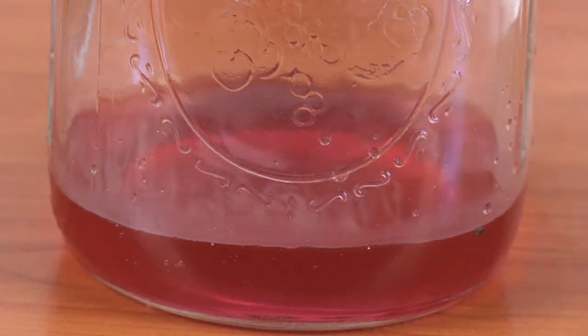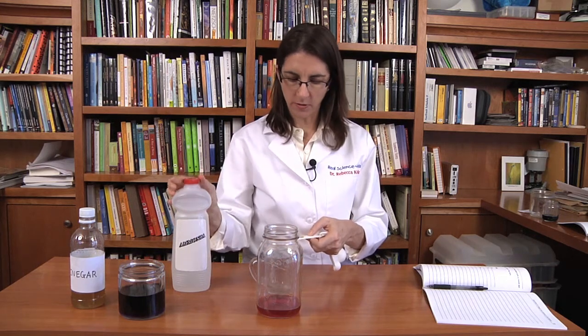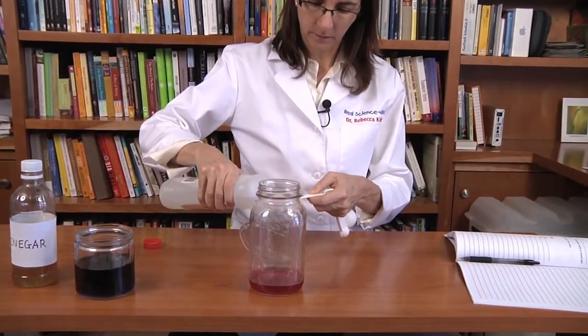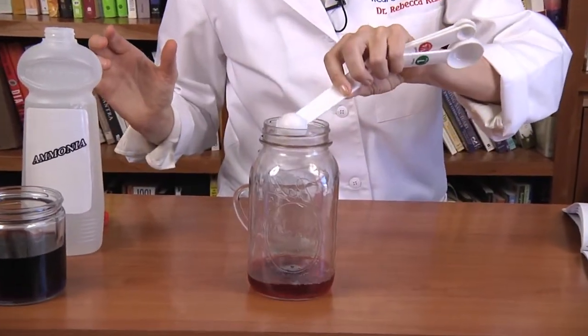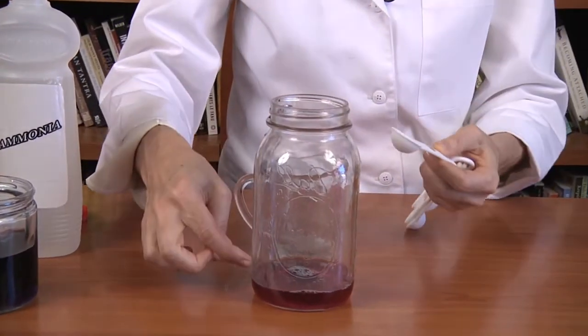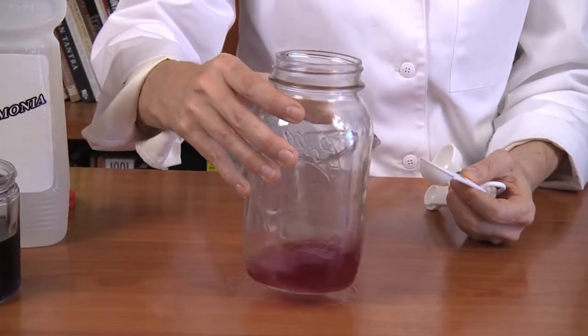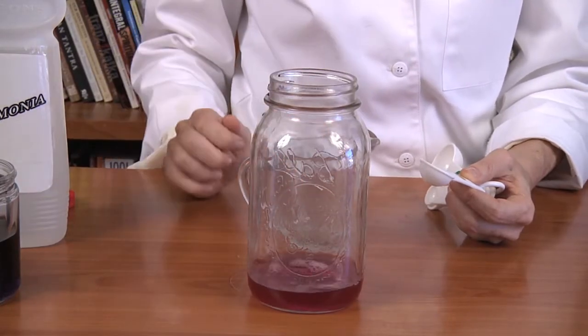And we're now going to add very slowly ammonia — one teaspoon at a time. So I have a measuring spoon and I'm just going to pour some ammonia into the measuring spoon, one teaspoon at a time. So that's one teaspoon. And you can see it immediately starts to turn green in the center. But as I swirl it, it turns pink again. So that tells me the reaction has not completed.